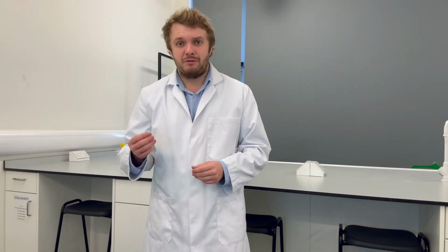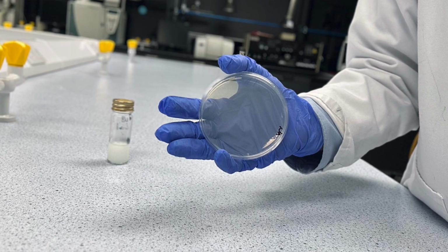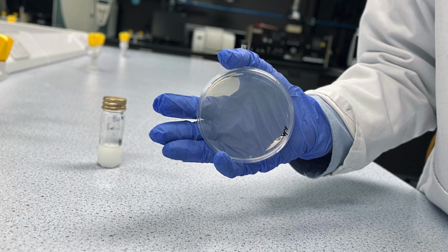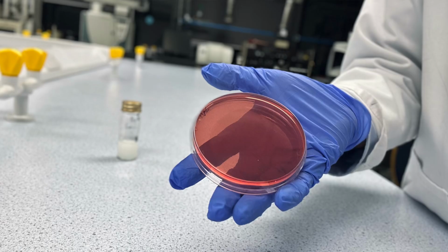Stage 2 of the activity requires a little more by way of material availability, but also empowers your students to engage in some of the staples of real-world microbiological investigation, in particular the construction of streak plates and the use of selective or characterising agar recipes. As you can see, in this instance I've opted to create a batch of nutrient agar plates which are general purpose and will cultivate a wide range of organisms that do not have particularly complex nutritional needs.